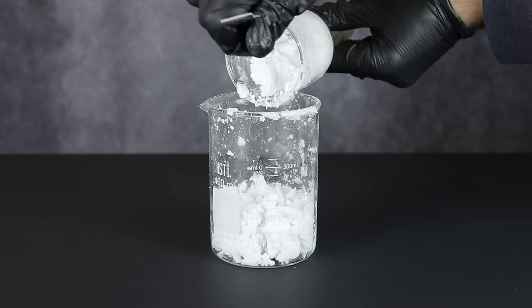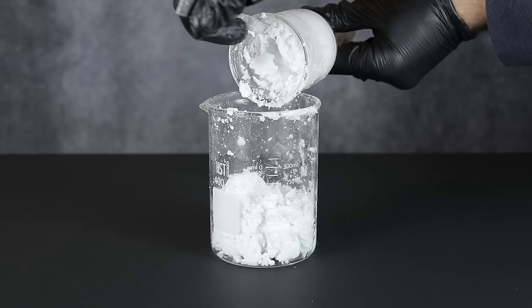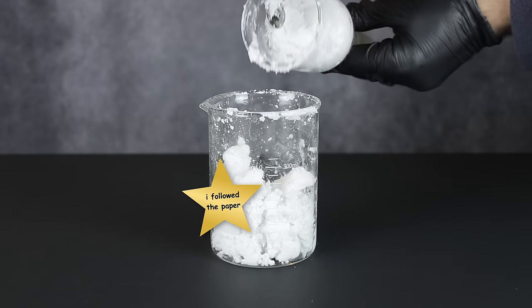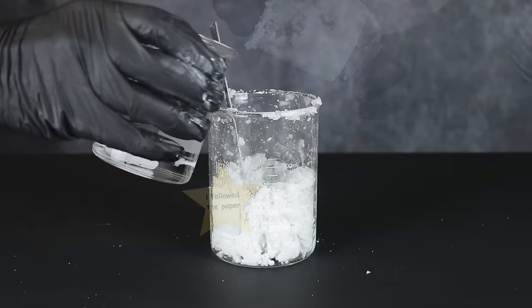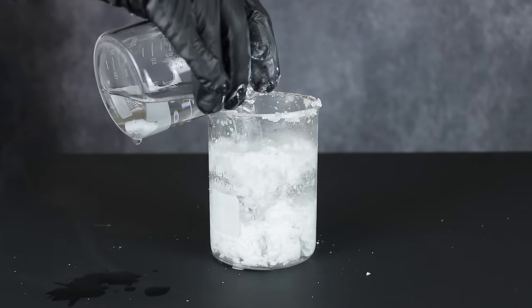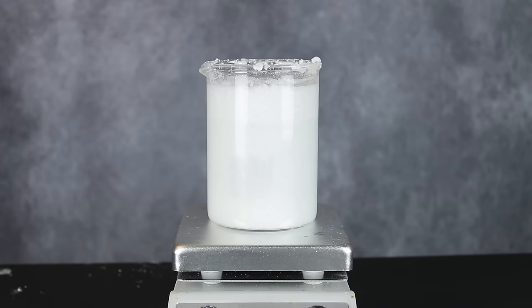Now, at this point, we could probably just move on to making the tert-butylamine, but I wanted brownie points for being a responsible chemist, so I decided to sacrifice my yield to the void known as recrystallization. For this, I added 250 milliliters of boiling hot water to my product and let it stir on heat until no more would dissolve.